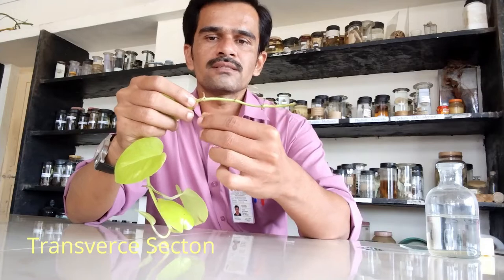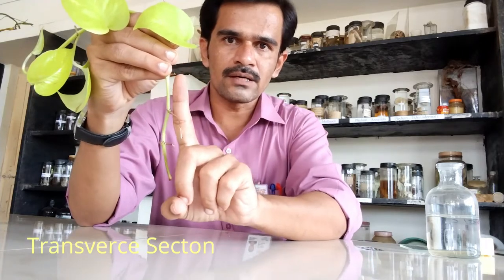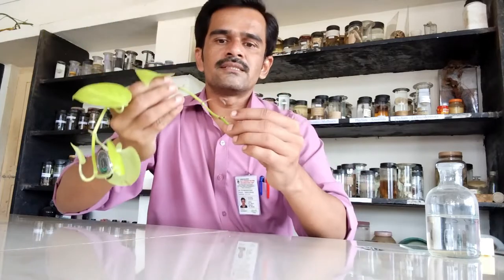We are going to take a section called a transverse section. This is the stem with its axis, and if we take a perpendicular section of that stem, that section is called a transverse section. Let's see how to take a transverse section.